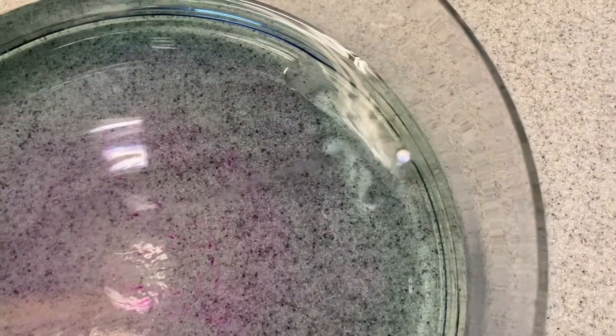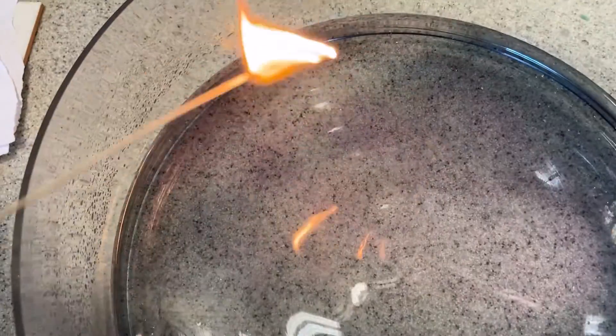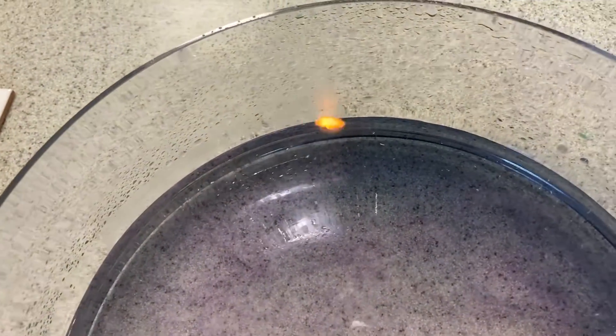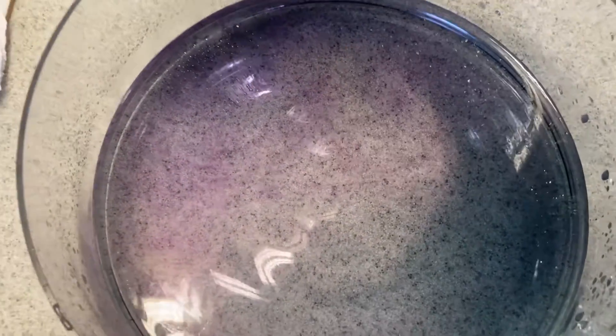It's producing hydrogen. It looks like it's melted and it's very, very hot. Let's try again with some sodium — we can light it. And that's burning away. You can see this purple around here — this is from the sodium hydroxide. The hydrogen again is flammable. Over there, where it didn't go, it's all green.